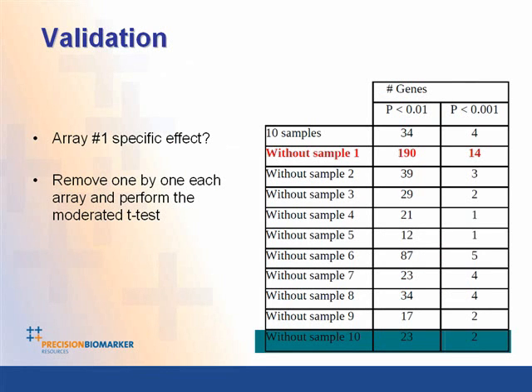So was taking out array 1 a specific effect, or was it just using less data? So if we go through and sequentially take out each chip and look at the column p-value 0.001, there's not much difference when you take out any other chip. It's only when you take out chip 1 that you get a significant increase in the number of genes that are still surviving a false discovery rate analysis.